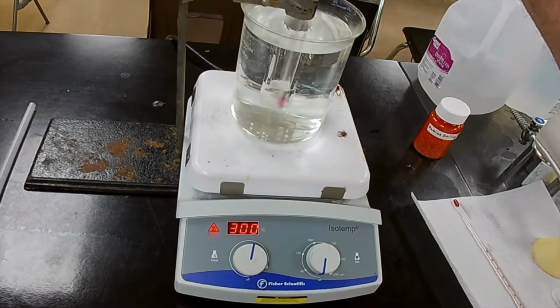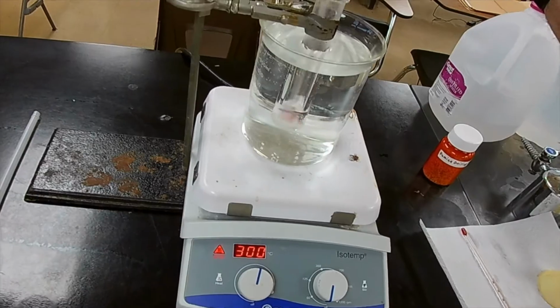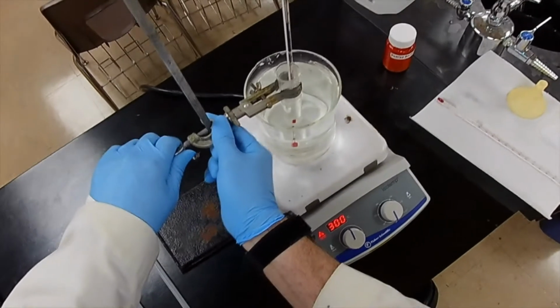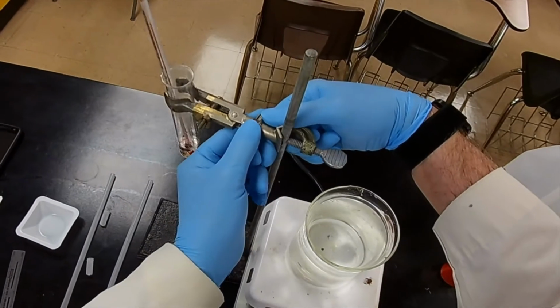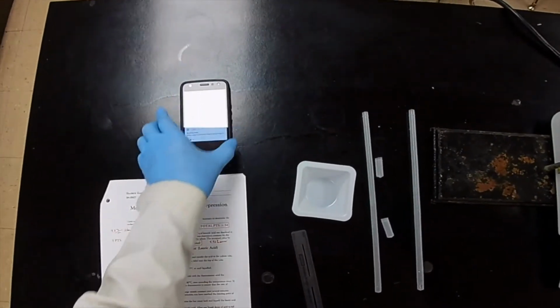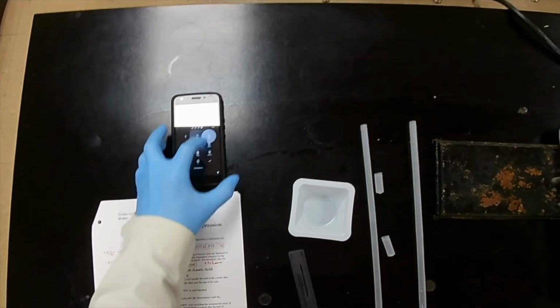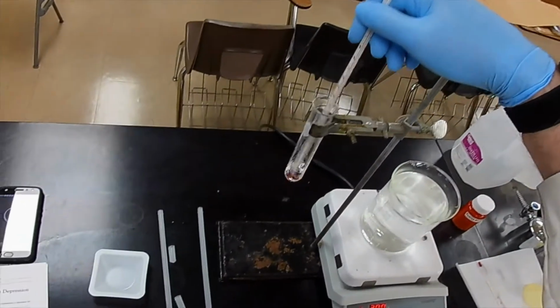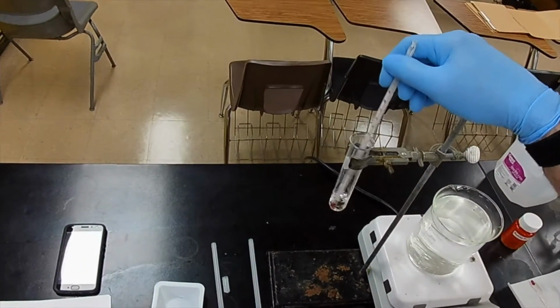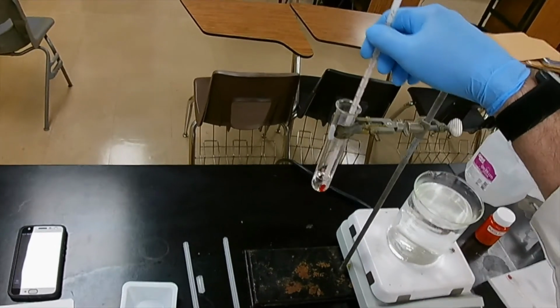Let's take another close look. Yeah, I think it is completely melted. All right. Okay, so now we can lift this out of the water bath and move it around here away from the heat source. And now we're going to start watching. Let me get my timer back. We're going to start watching the temperature. And when the temperature drops to 60 degrees, that will be our 0 point. In fact, if I start exactly at 60 degrees on my timer, then I can wait for 30 seconds and write both of those temperatures on the board.